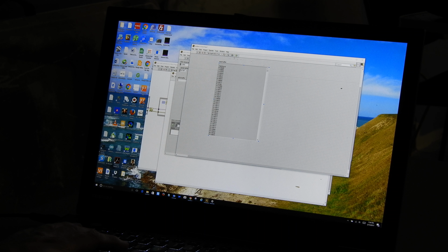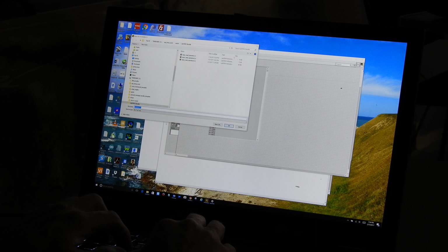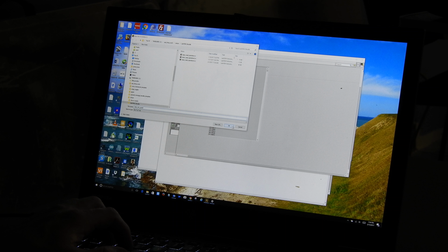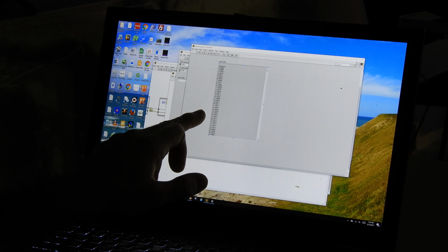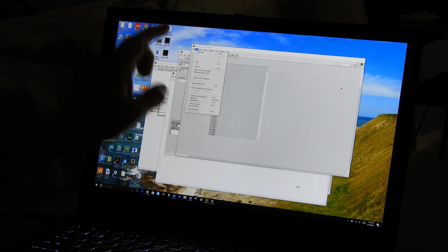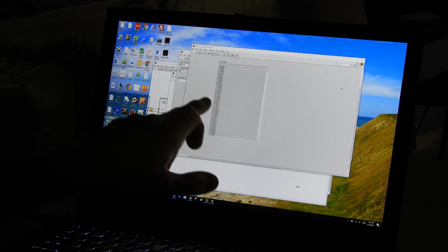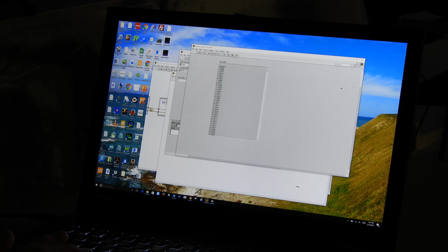So I'm going to go ahead and save this at this point, and I'm going to call this data into graph.vi. So when I say OK, it's saved data into graph. And then to make sure that I maintain the data, I'm going to go to the Edit tab and say make current values default. When I click that, it takes these values that are in this textual control and it makes them the default values. Then I'm going to save the VI once more.